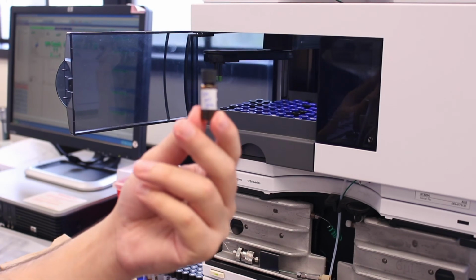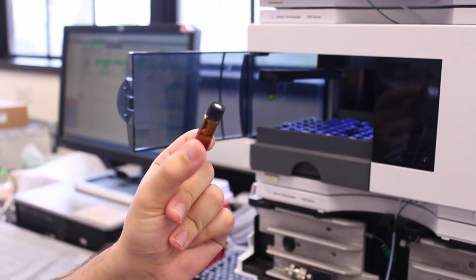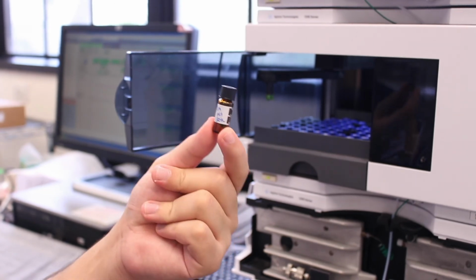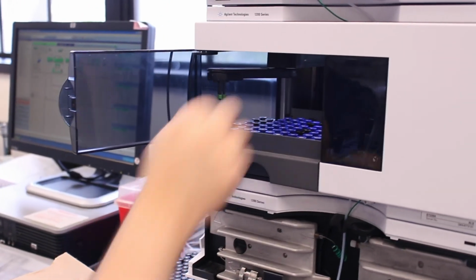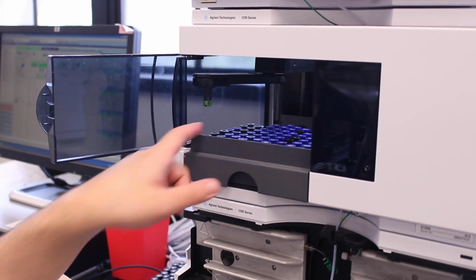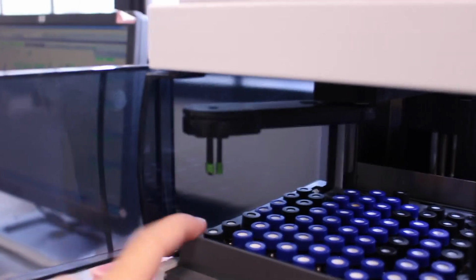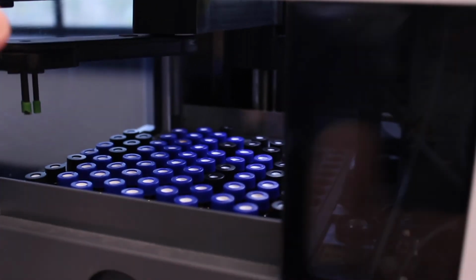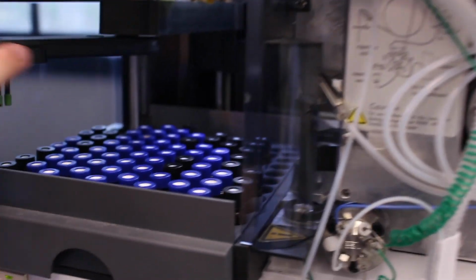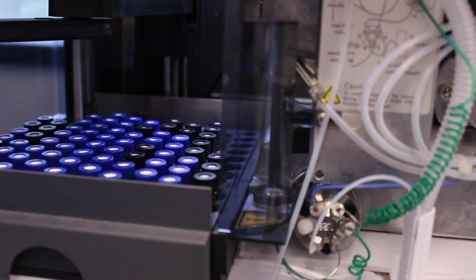We have our sample here, so if you remember, we took a little bit of the solid from the filter and we dissolved it in some acetonitrile. And now we're going to place this into the tray here for the arm to sample. So what you'll see is that this arm will grab the vial, and then it'll take the vial to here. Maybe if I take this off, you'll be able to see it. But there's a robot arm here. It picks up the vial, and then it'll take it here where it will use a needle to take some up and then inject it into the mass spec.